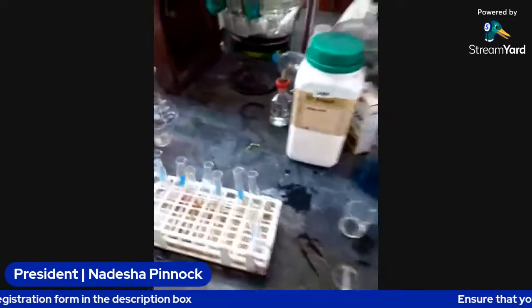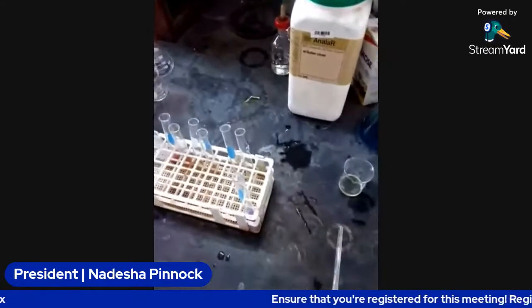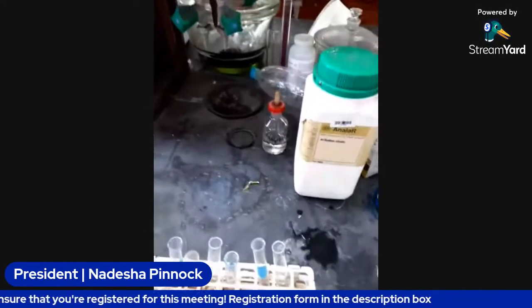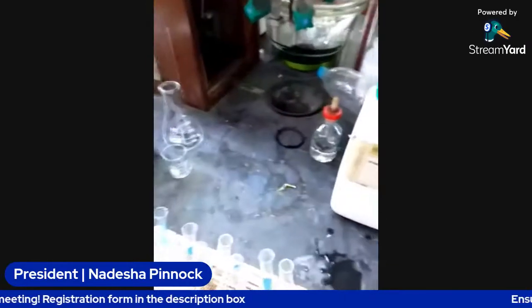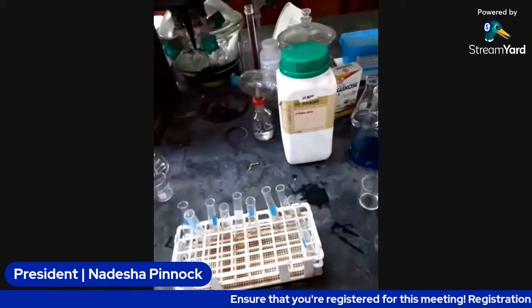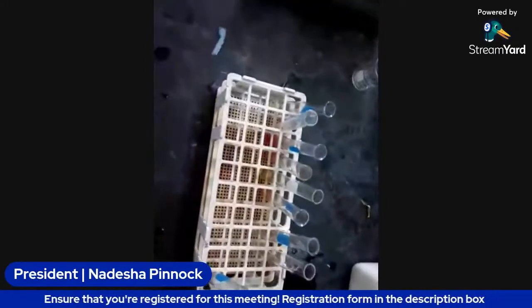All right. So the first test that we want to do is the reducing and non-reducing sugar test. Before we start doing the test while we're prepping, we're just going to go through some of the theory regarding reducing and non-reducing sugars.